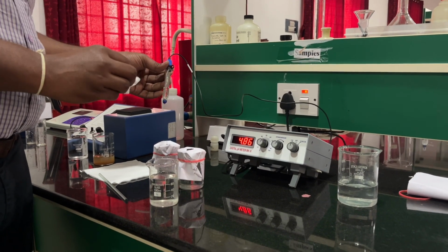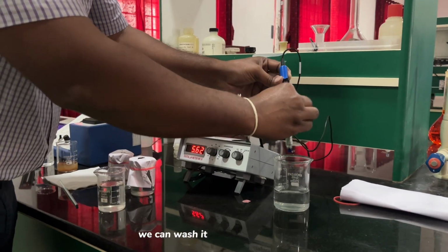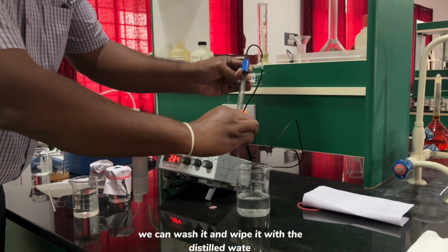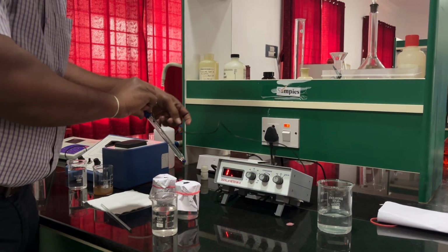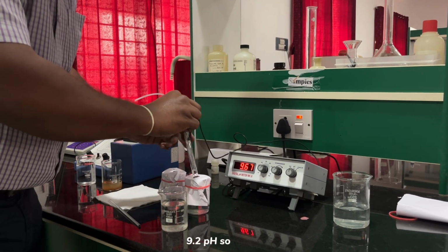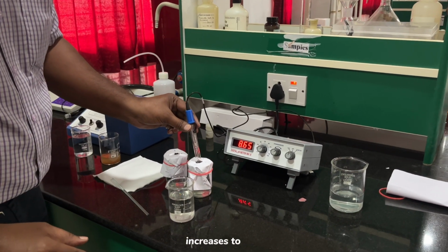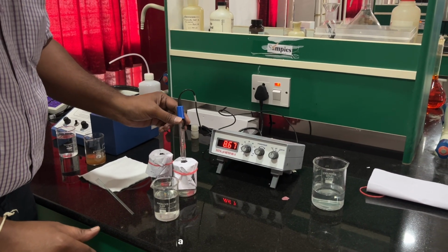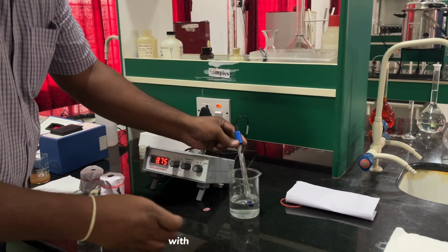It will be around 4.2. It drops drastically to it, and again we wash it and wipe it with distilled water, and calibrate with the 9.2 pH solution. You can see that it increases drastically to 9.2. Again we wash with distilled water.